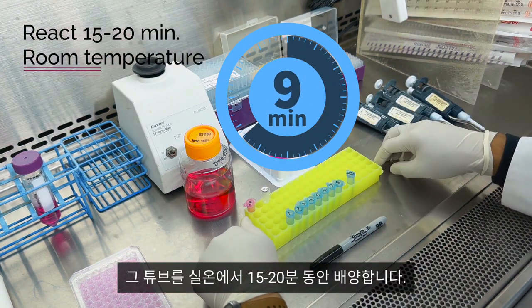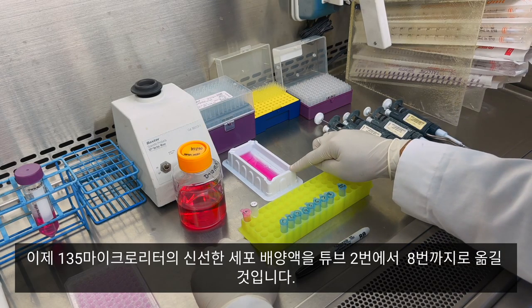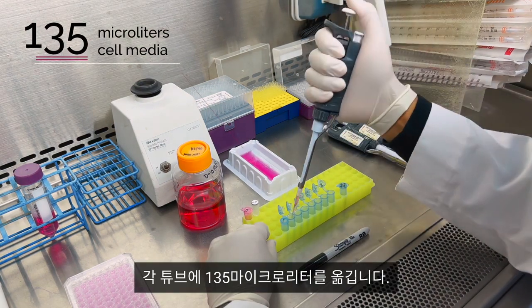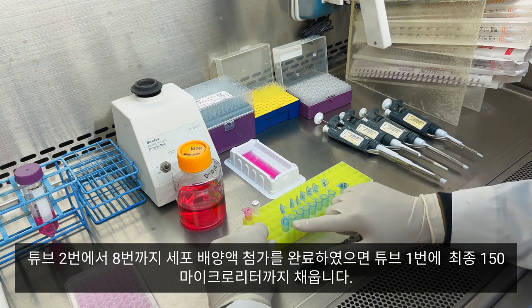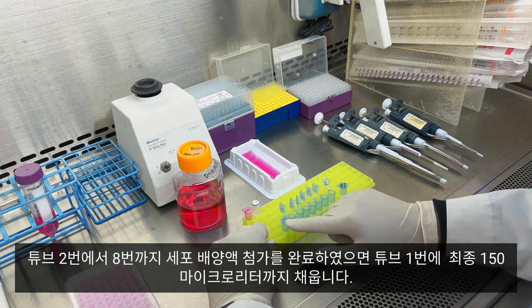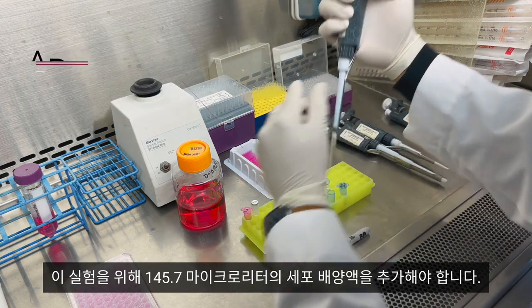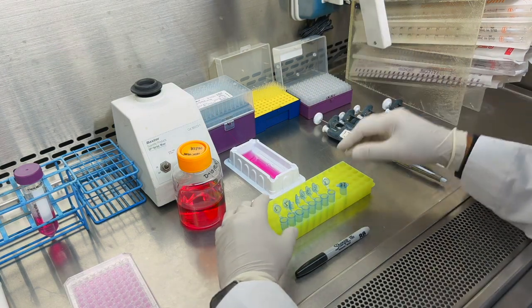We will incubate that tube at room temperature for 15 to 20 minutes. Now we will transfer 135 microliters of fresh cell media into tubes two through eight. Transfer 135 microliters into each tube. Once we finish adding cell media to tubes two through eight, we want to bring up the final volume in tube number one to 150 microliters. Consult the Excel workbook for the volume calculated. For this experiment I need to add 145.7 microliters of cell media. Now let's cap each tube.